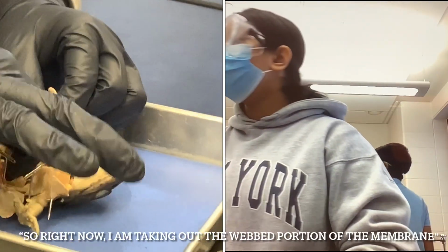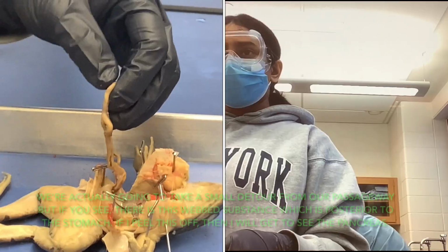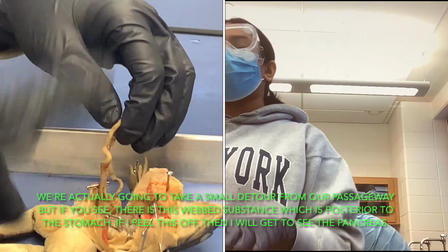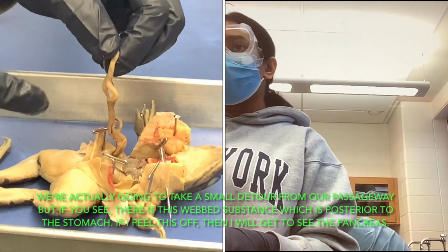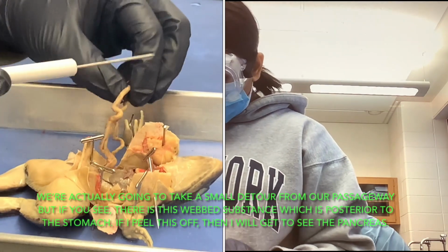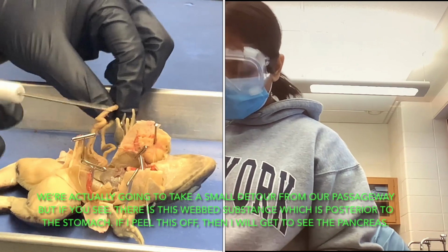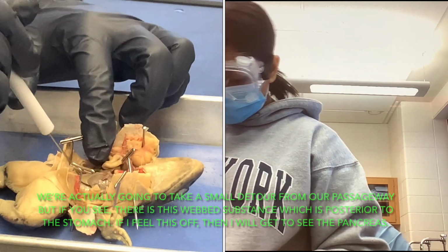So right now I am taking out the little webbed portion, or the membrane. We're actually going to take a small detour from our passageway, but if you see, there is a webbed substance that is posterior to the stomach. If I peel the webbed stuff off, this is the intestine, but we'll get into that later. And I think I'll just tuck it away.